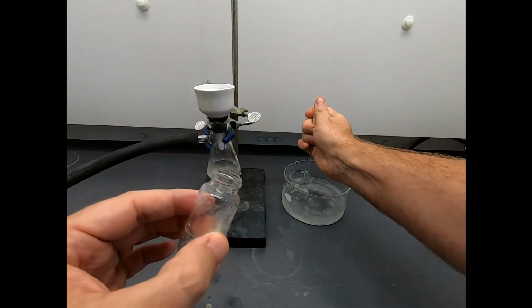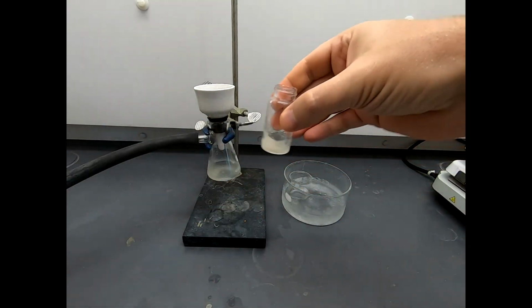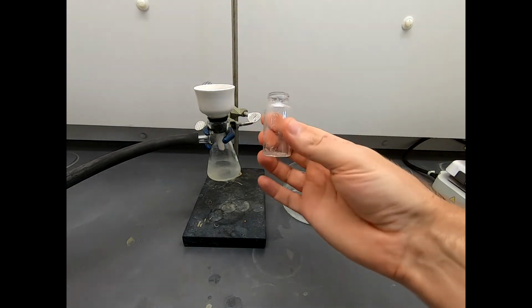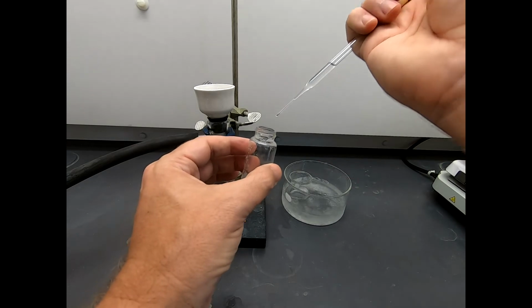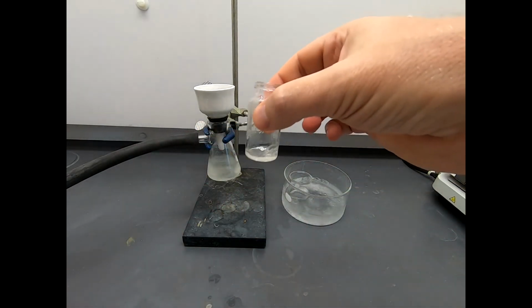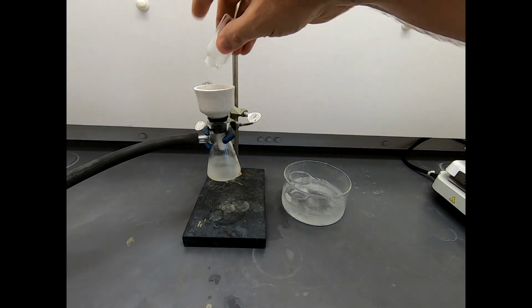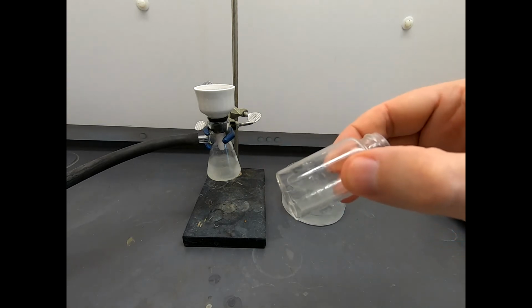That's okay. That's why we have this rinse solvent. We can use this rinse solvent. Now let's resuspend and let's pour it a little more quickly, and that'll help get things transferred. Now this isn't perfect, but it's a whole lot better than it was the first time. Do that same thing again. Get this nice and suspended and just dump it in. Perfect. Now that's not absolutely pristine, but you know what?